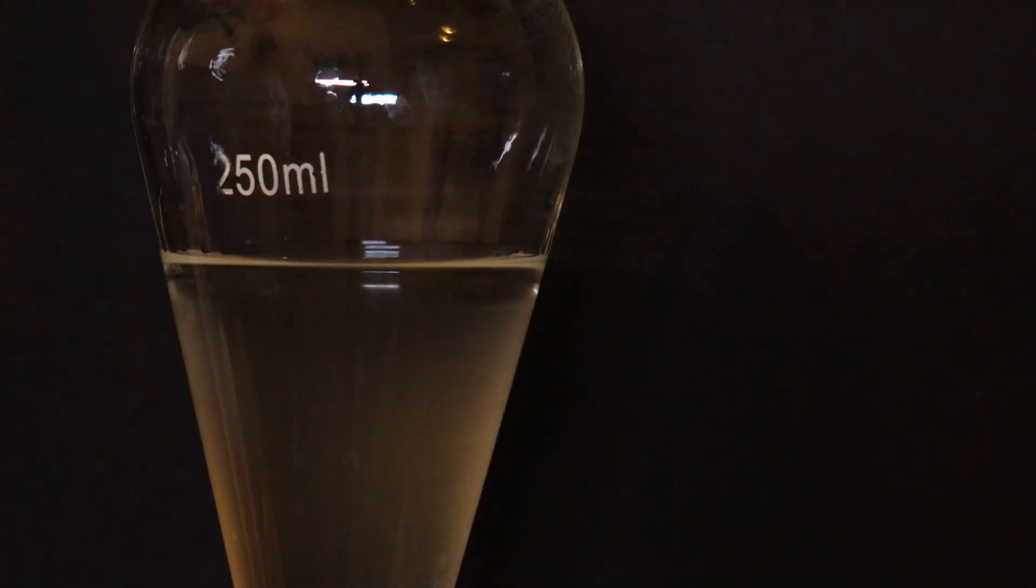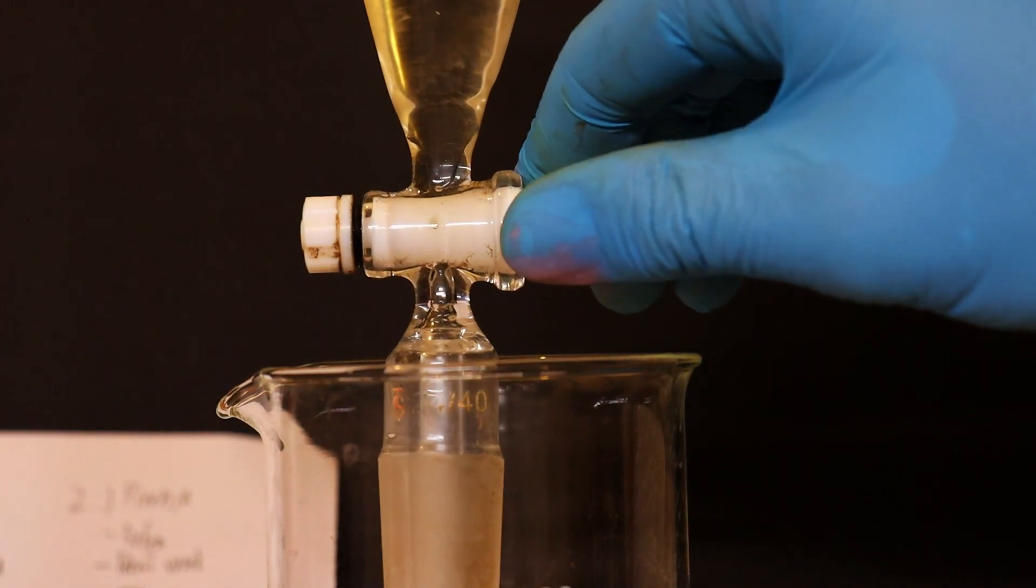Now, we need to leave the mixture for some time to allow the layers to separate. The upper organic layer is our product.